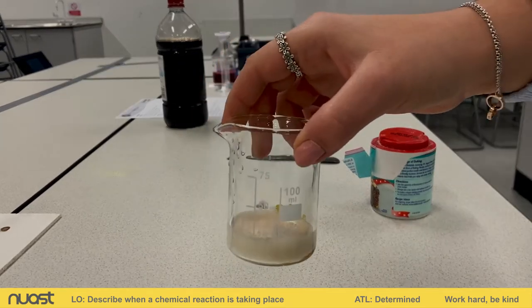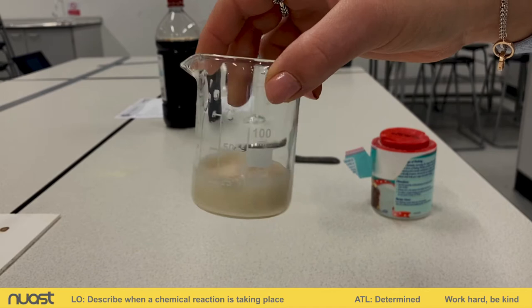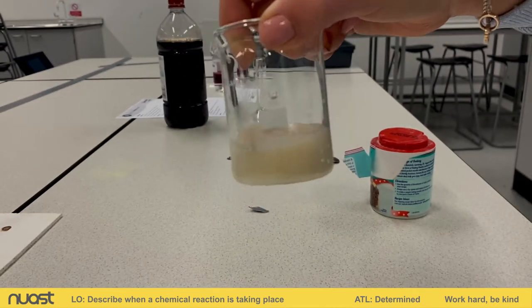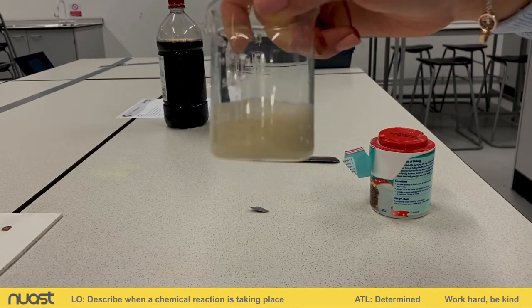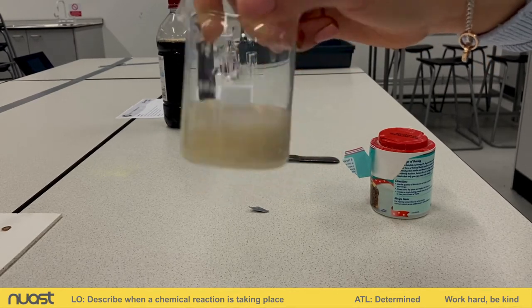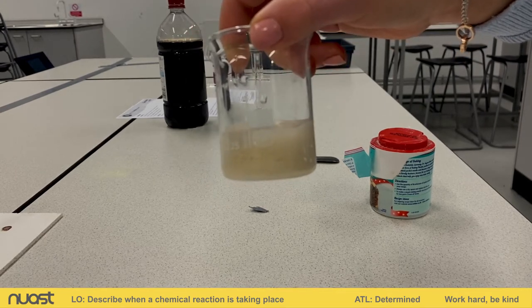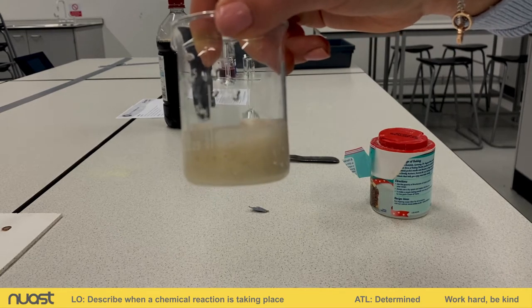If I hold that up a bit closer to the camera, what we can see is that we're seeing a lot of fizzing. We're seeing that layer of bubbles on top of our vinegar — it's getting bigger. We're getting more vigorous bubbling and there's a lot of fizzing happening there.